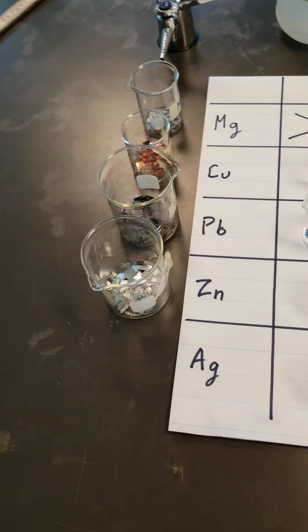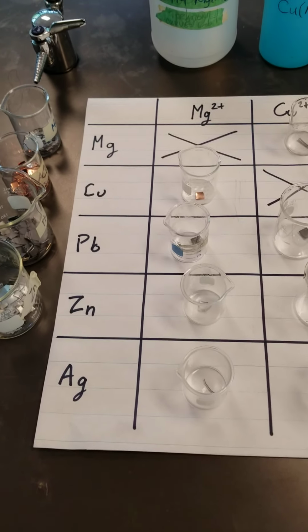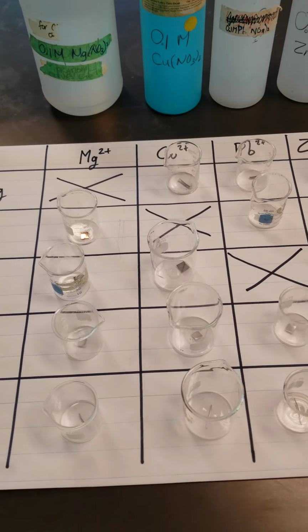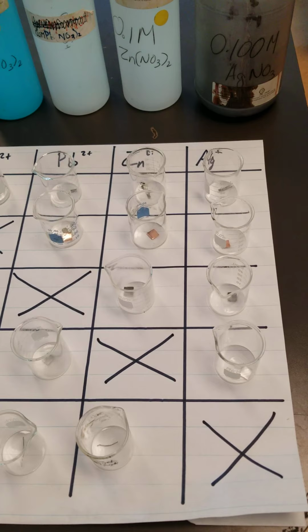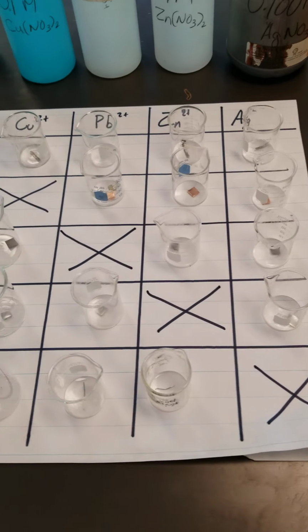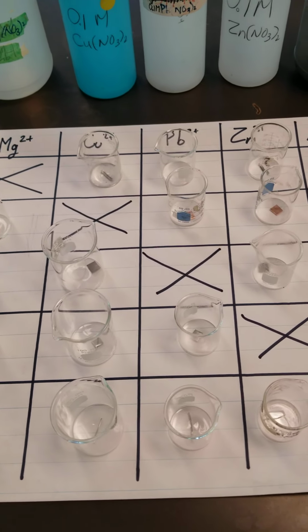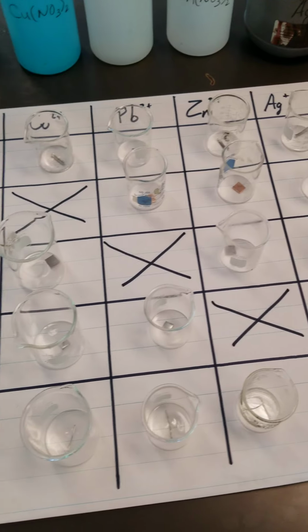Hi there, folks. As we're talking about electrochemistry, we're talking about spontaneous and non-spontaneous reactions. Now, what I'm going to demo here is a lab that we would normally be doing in session. However, I'm going to do it here for you to help you understand how to determine a spontaneous and non-spontaneous reaction and how to compare those to what is on the table of values at the end of our textbook.